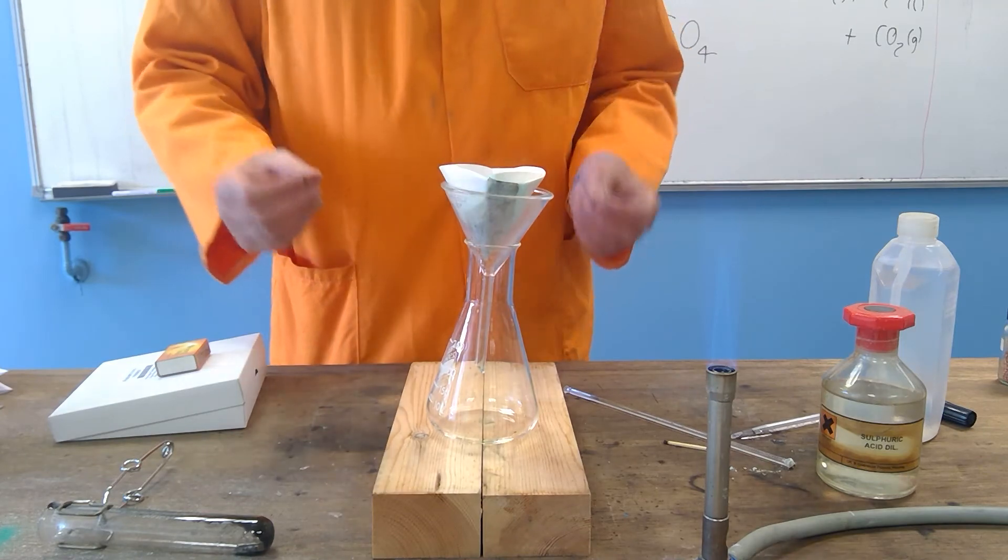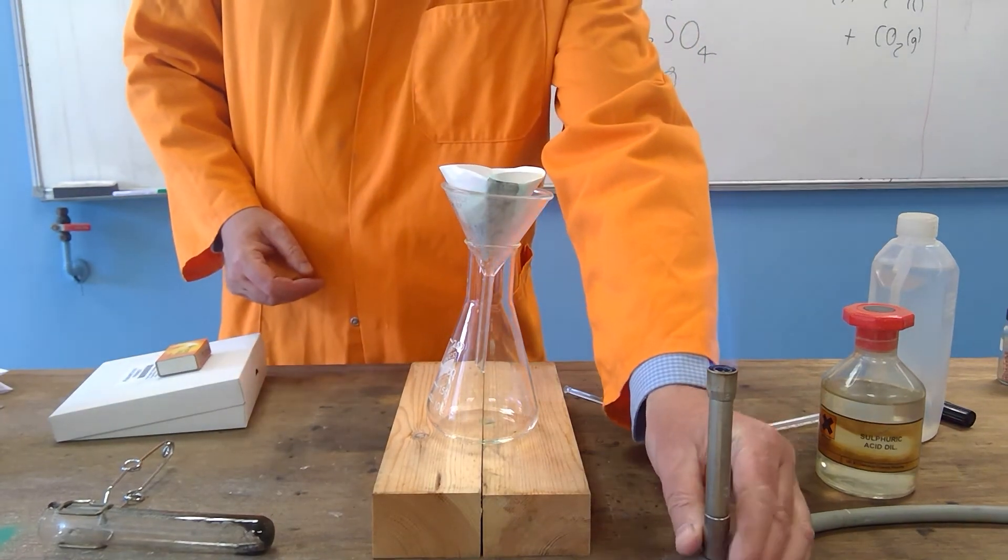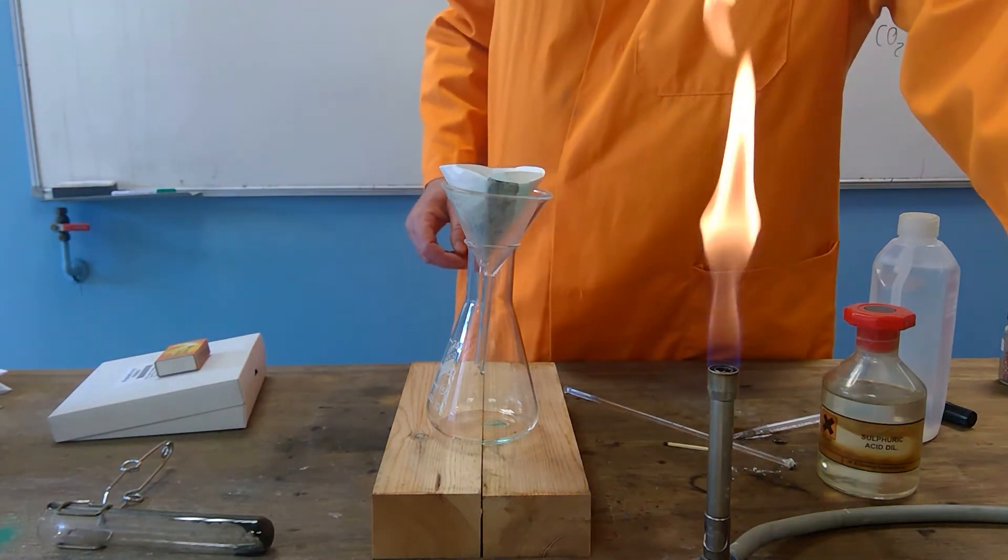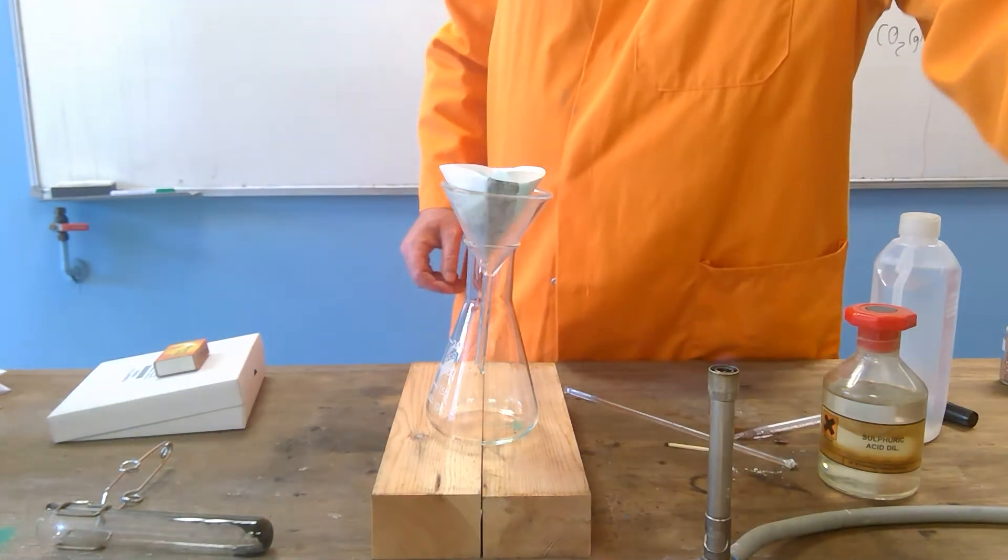The particles which are small enough will pass through the filter paper, and those that are large will get trapped and won't fall through the holes, so it takes a while.